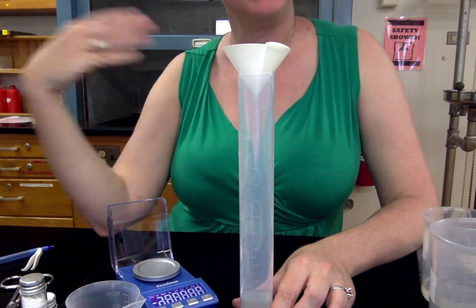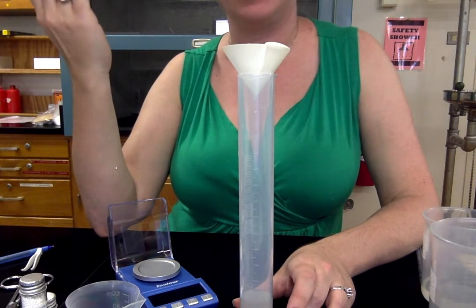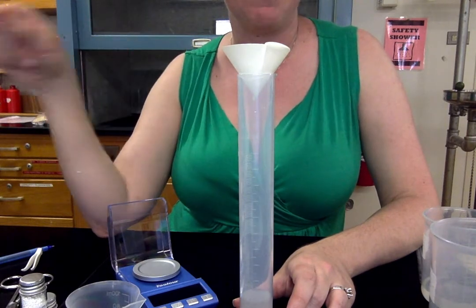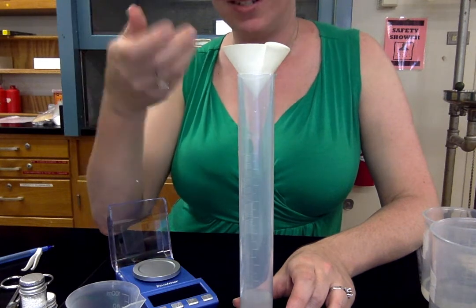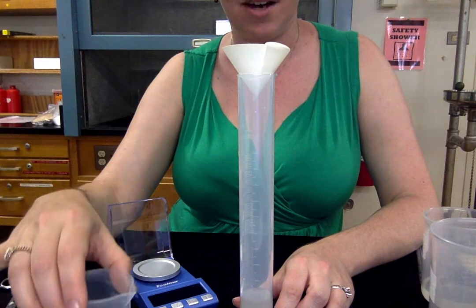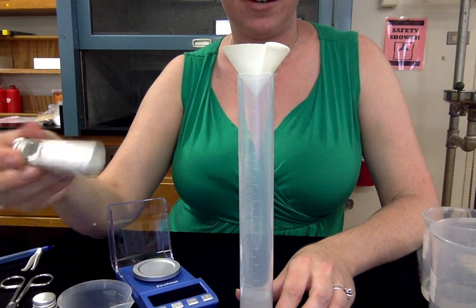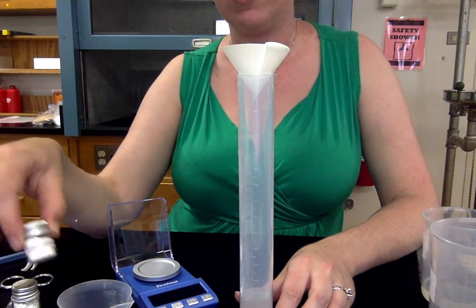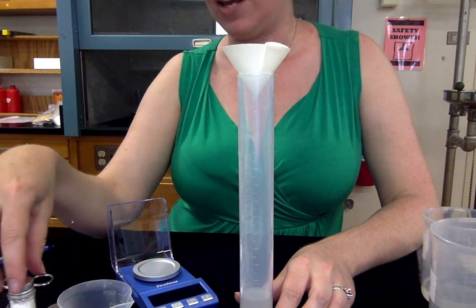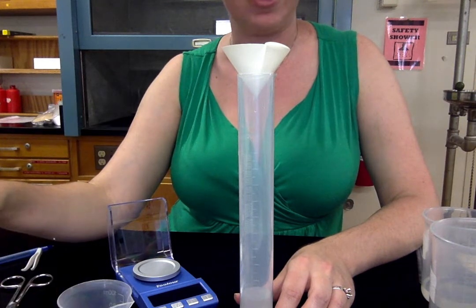So it has the same safety features as chalk and it would be irritating if you breathed it in. So don't breathe it in. I don't know if you could actually write with it on something black, but it's safe to discard in the trash when you're done. And all of these solutions are safe to discard down the sink. And you can either send back your extras of these chemicals, or you can discard them in the trash. Never consume chemicals that come with your chemistry lab kit, even if they are consumables.